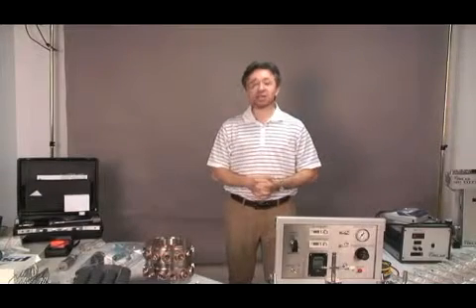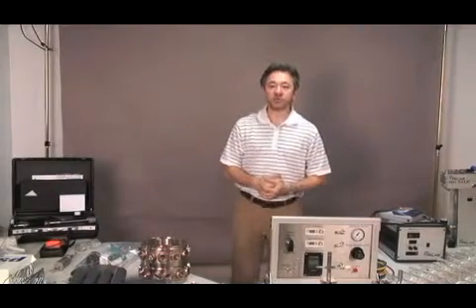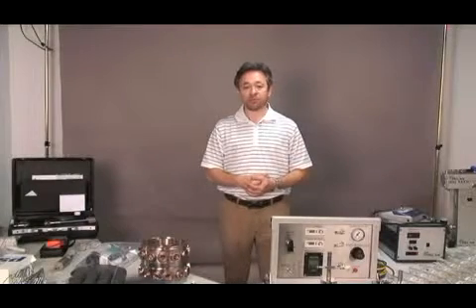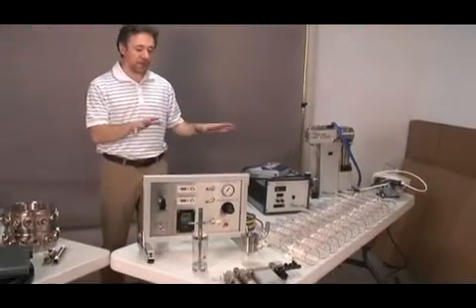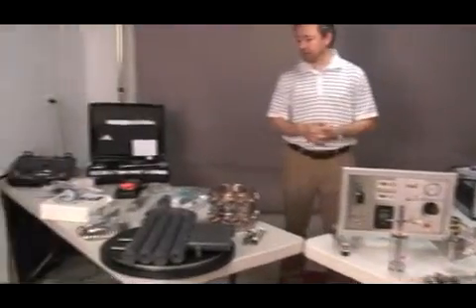My name is Drita Angelari from CH Technologies, and we're here today to demonstrate the assembly and the operation of the inhalation exposure system that is going to be installed in your facility. As you see here, we have laid out all the units and the different items of the inhalation exposure system.